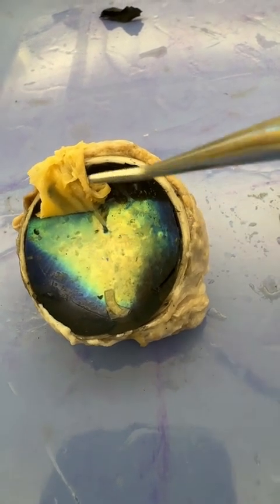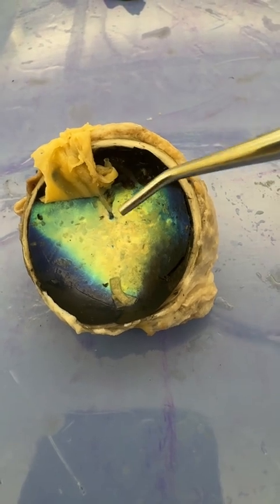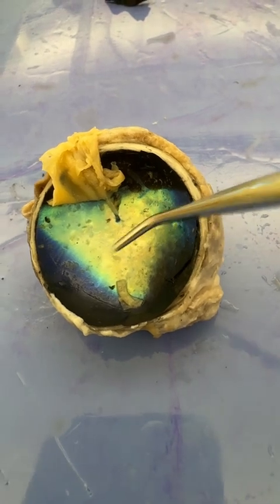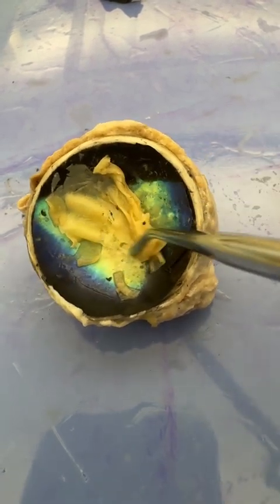The tapetum lucidum is in animals that are usually prey animals that live at night. This allows them to be able to see well at night. The light comes in and it reflects around a little bit better. So it really helps them see better at night. That's your night vision. We don't have that. I kind of wish we did.